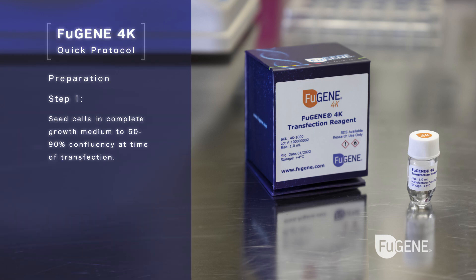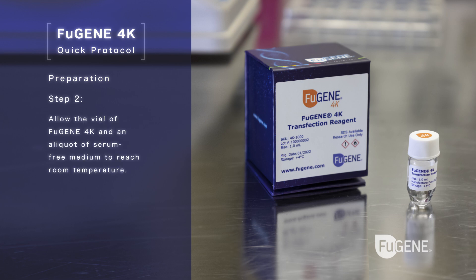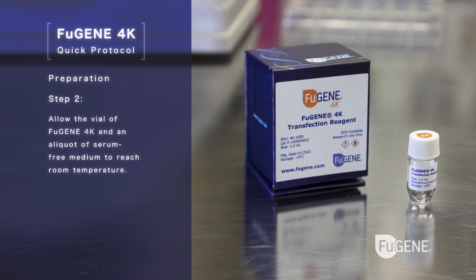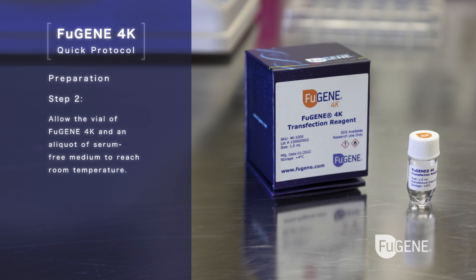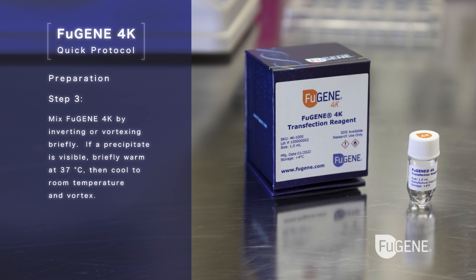Preparation step 1: seed cells in complete growth medium to 50 to 90 percent confluency at time of transfection. Step 2: allow the vial of FuGENE 4K and an aliquot of serum-free medium to reach room temperature. Step 3: mix FuGENE 4K by inverting or vortexing briefly. If a precipitate is visible, briefly warm at 37 degrees Celsius, then cool to room temperature and vortex.